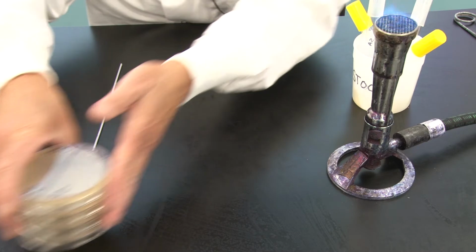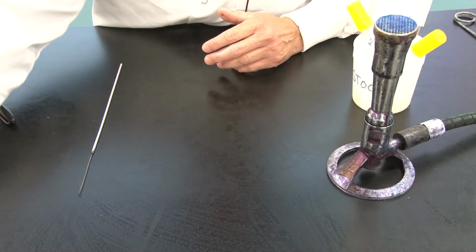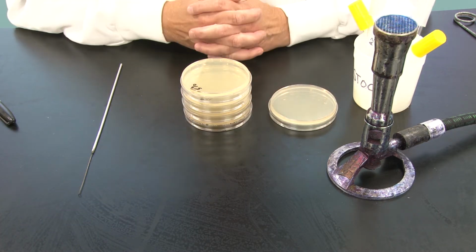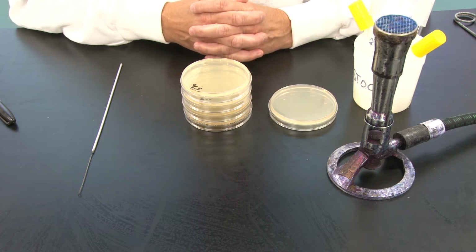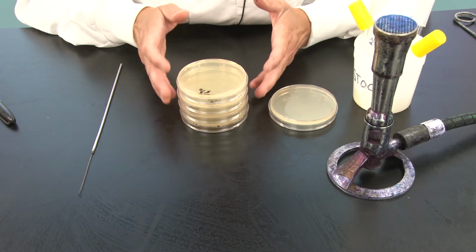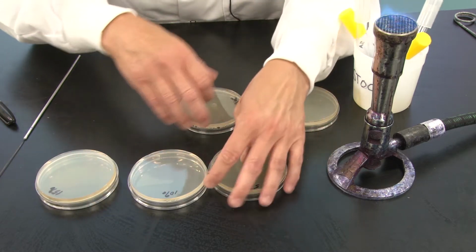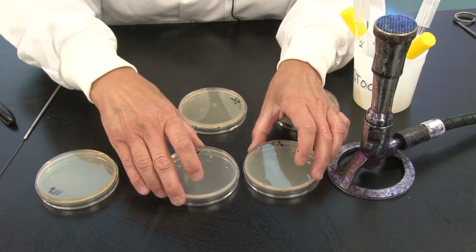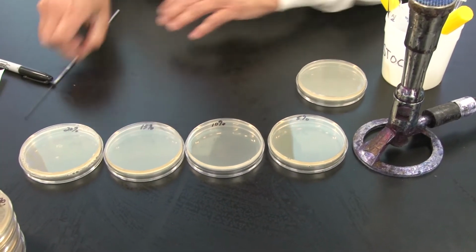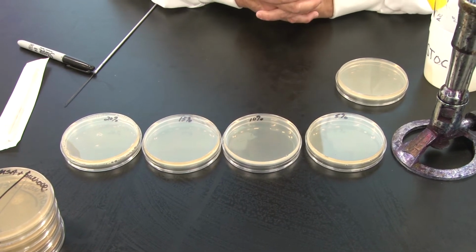We'll do that after we set up our salt plates. I'm going to go ahead and pull out our salt plates now. Remember that when we made our media in session 6, we created a 5, 10, 15, and 20% solution of sodium chloride with our beef extract, our agar, and our water. Then we swirled them around and poured the plates, and here they are.